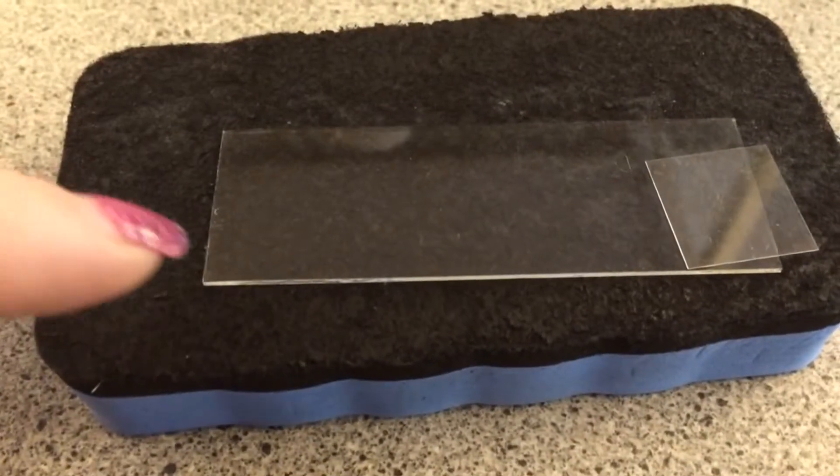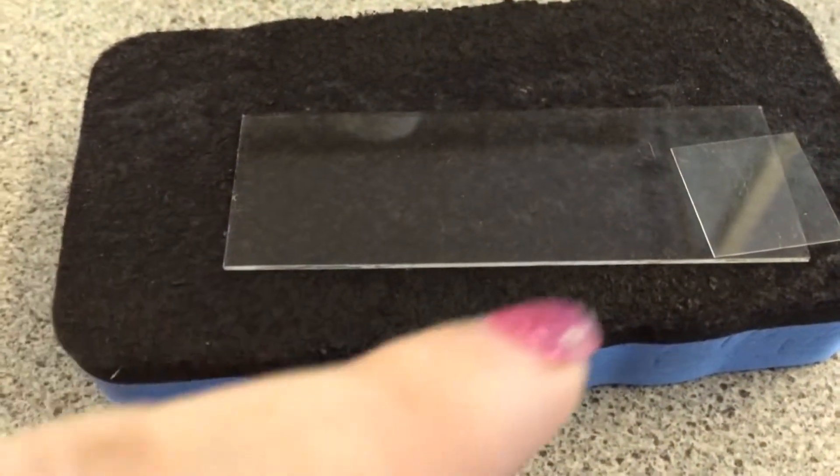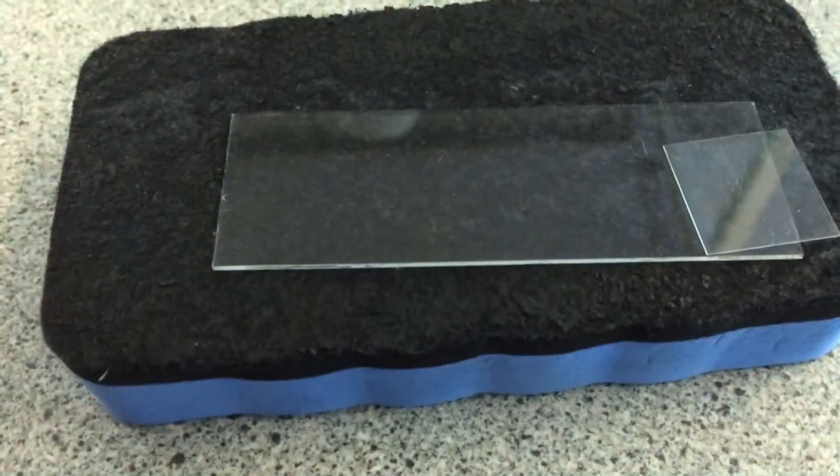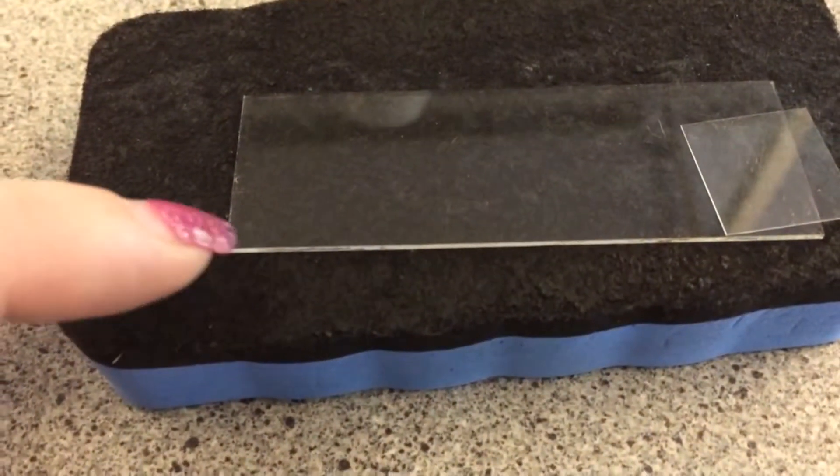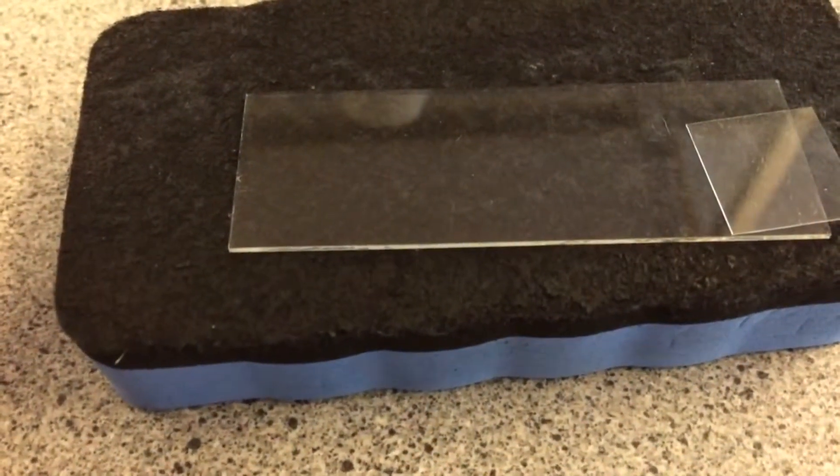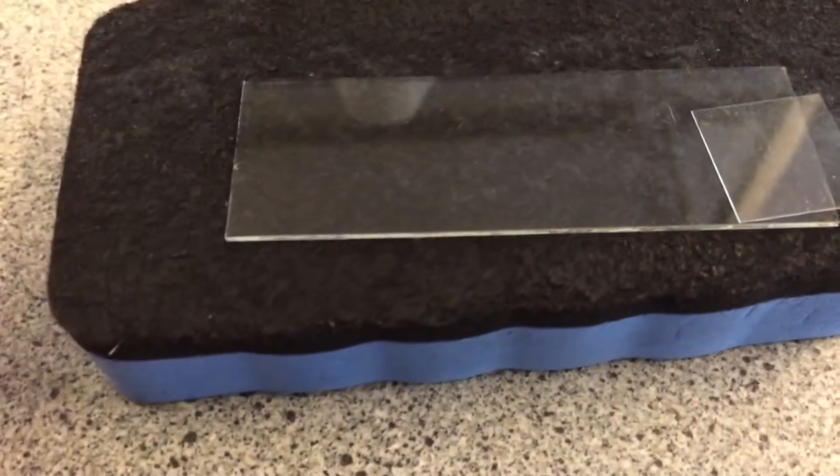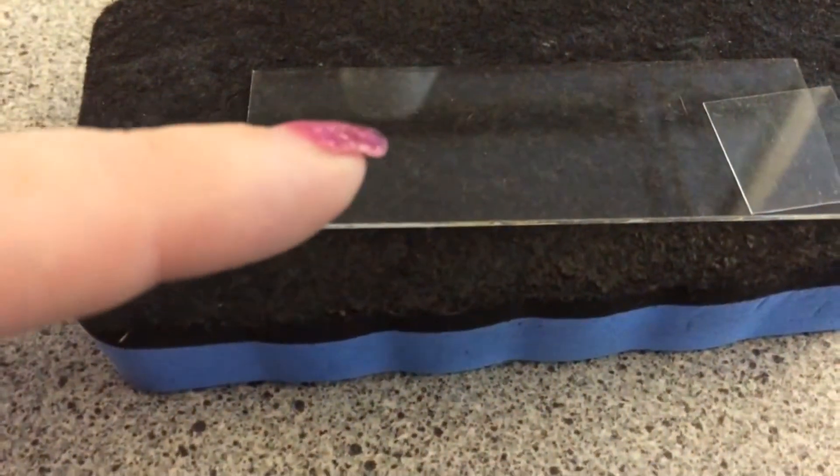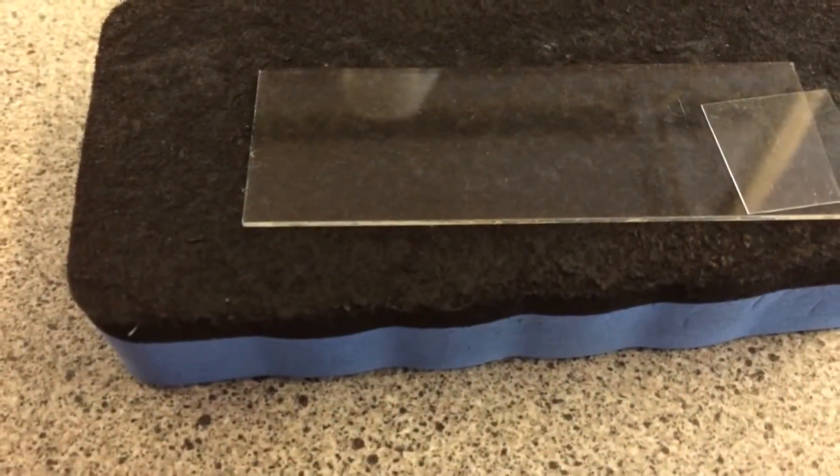If you want to test how crystals form at different temperatures, you're going to need some slides and some cover slips. Hot slides and cold slides work best for this. Just pop a drop of salol and then pop the cover slip on top.